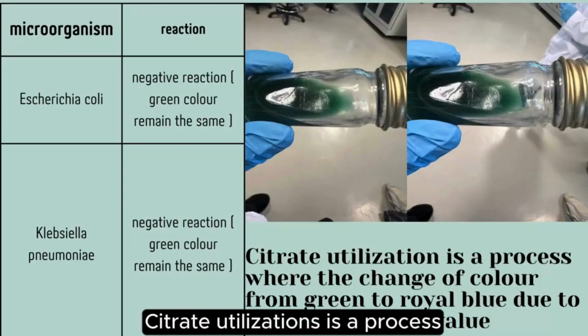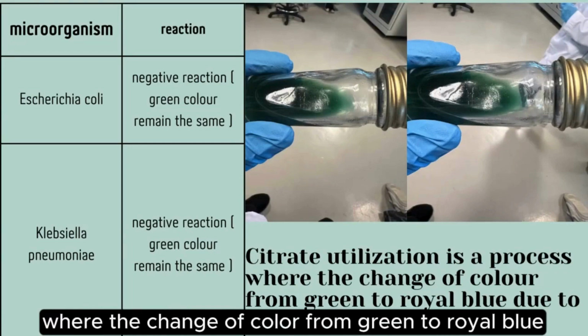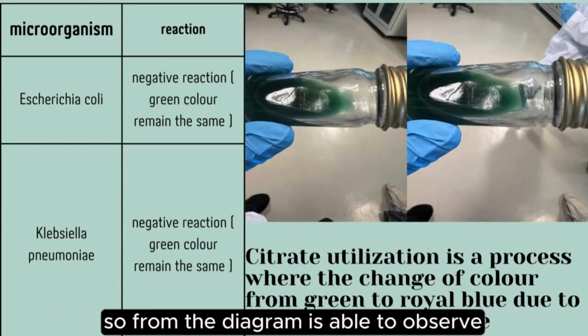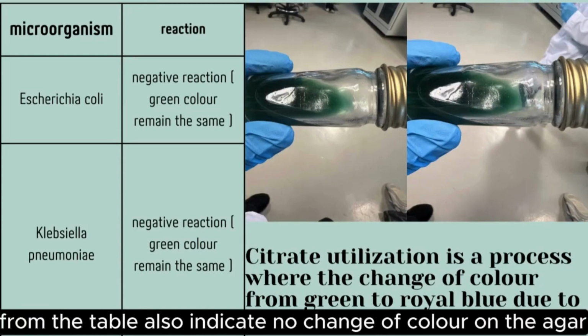Citrate utilization is a process where the color changes from green to royal blue due to the change of pH. So from the diagram, we are able to observe that there are no observations provided. So from the table, we are able to observe there is no reaction, which indicates a negative reaction, as it doesn't have a color change.